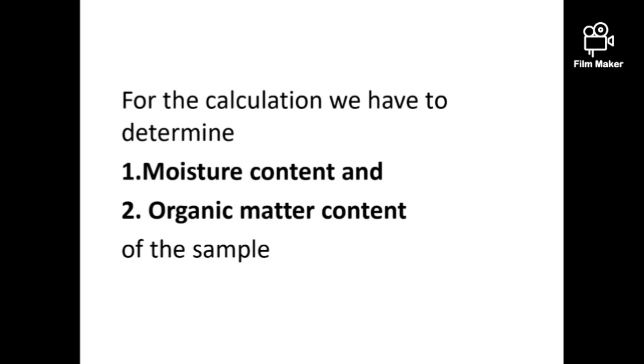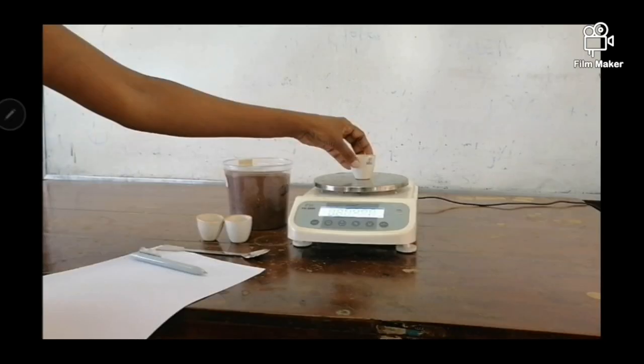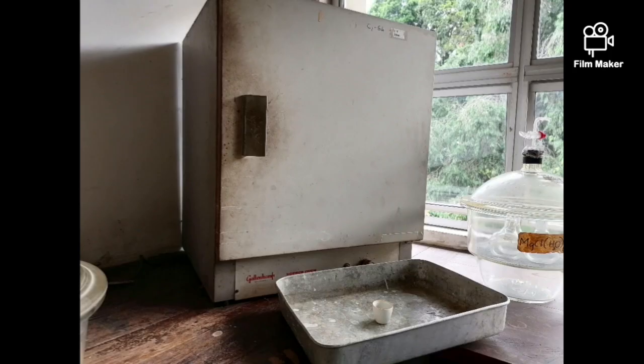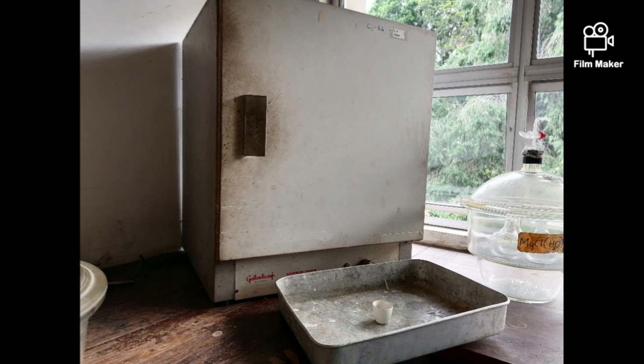First, take the empty weights of crucibles and weigh in 10 grams of soil. Then place them in the oven until they reach a constant weight, which usually takes 6 to 8 hours. This process only removes the soil moisture content.